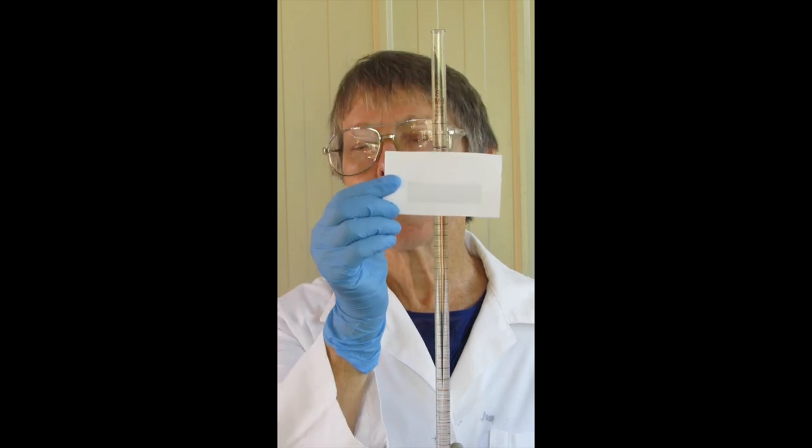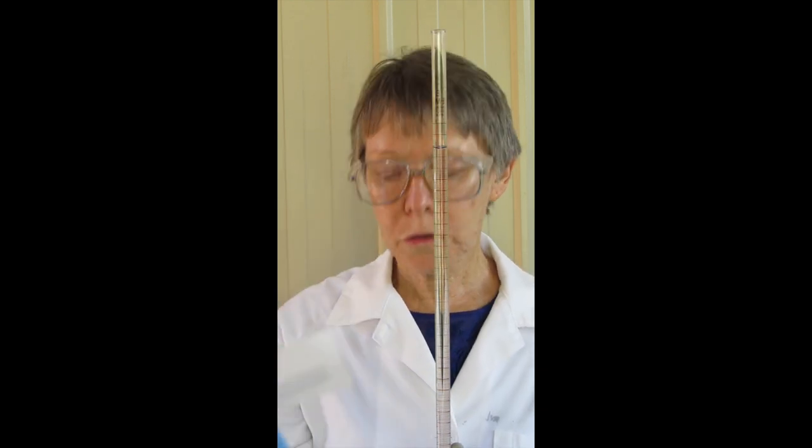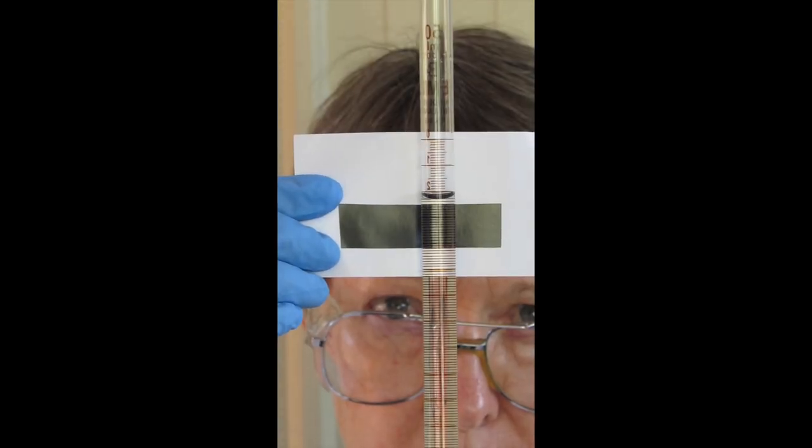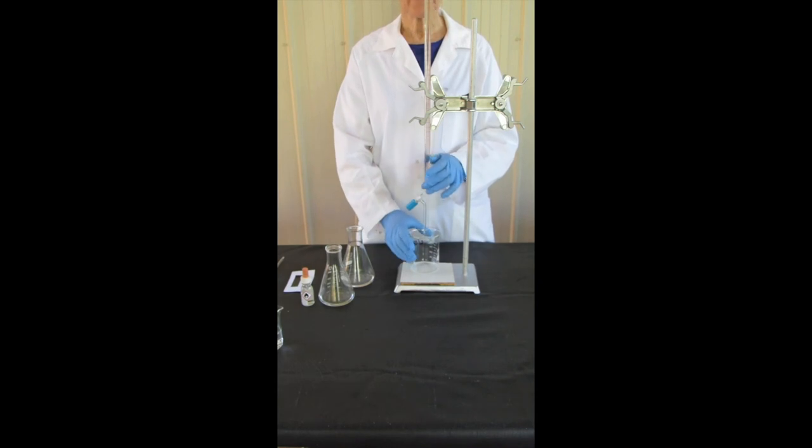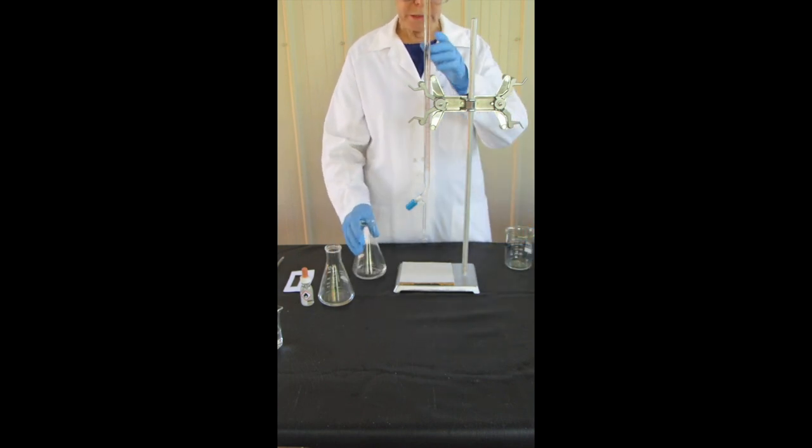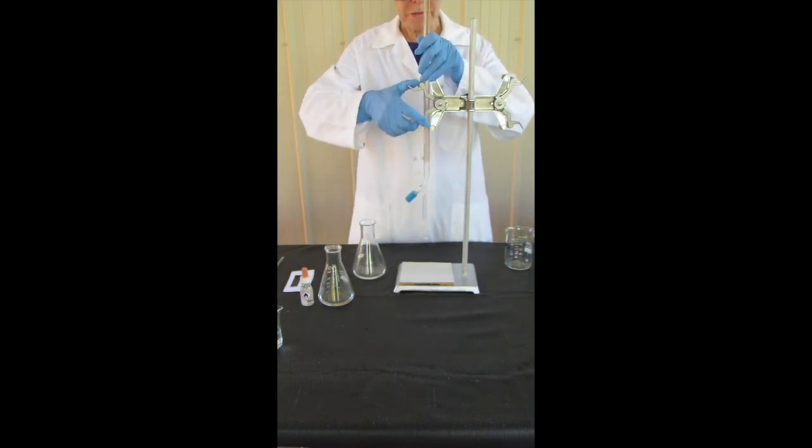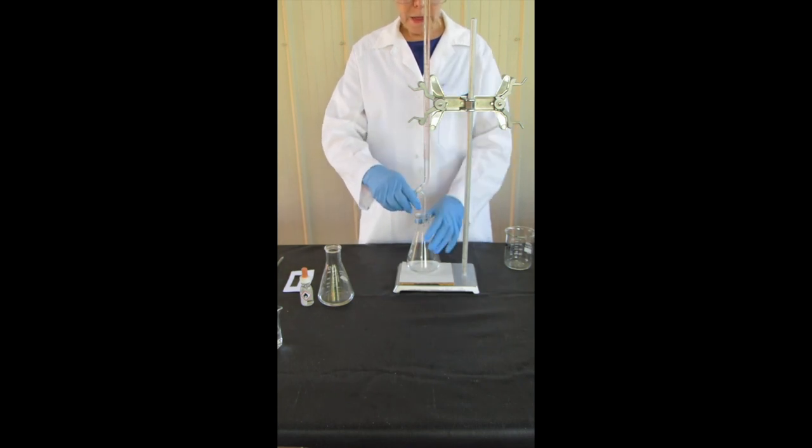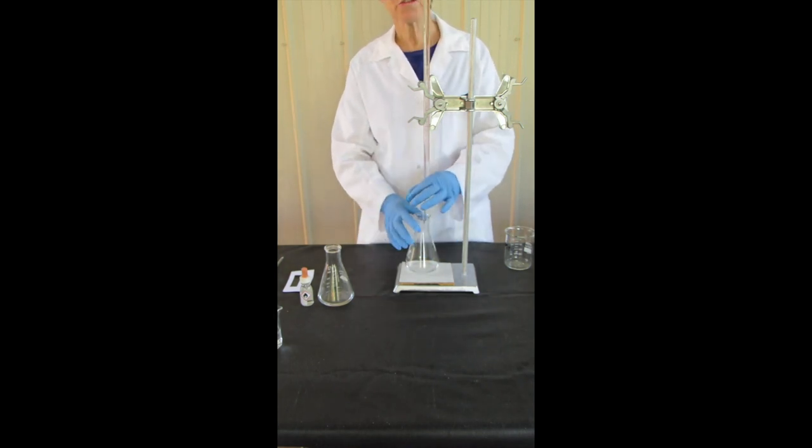In this case I'm reading 2.31. Before I start my titration I must remove the waste beaker, make sure I don't have a drop hanging on the tip, and place my flask underneath the tap. The tip of the burette should be inside the neck of the flask. The correct procedure is your left hand wraps around the tap while your right hand swirls the flask.